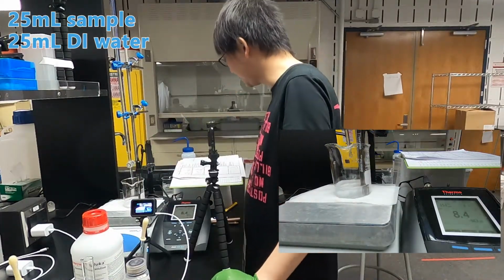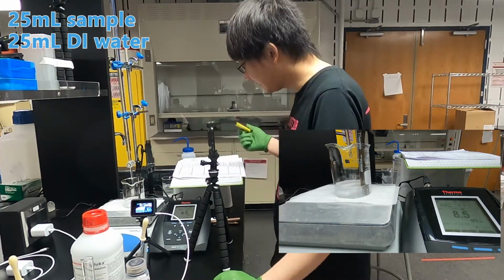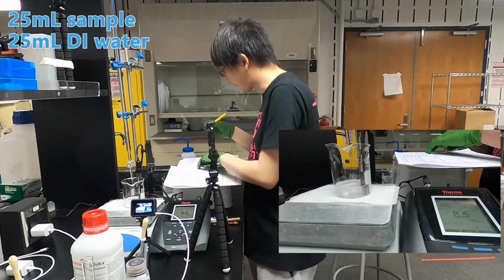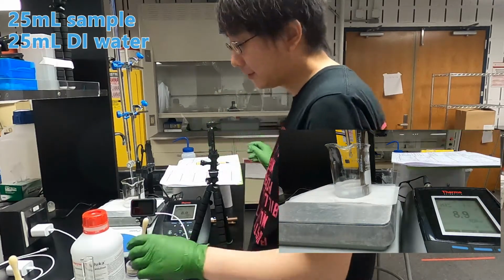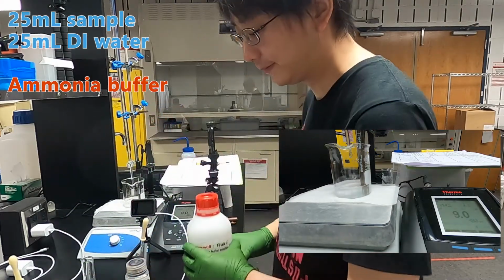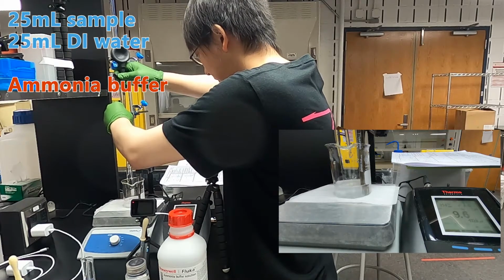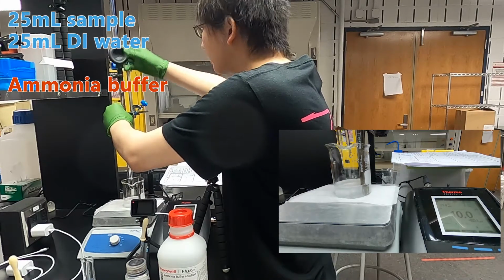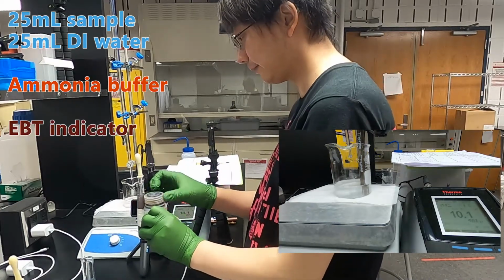We can see that the pH is also very basic, and then we write down this pH. And then we add ammonium buffer to the solution. And then we add EBT.